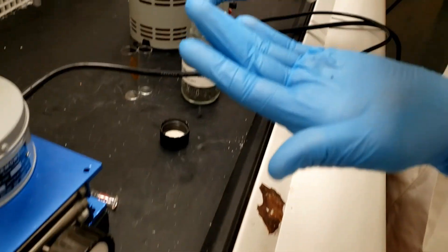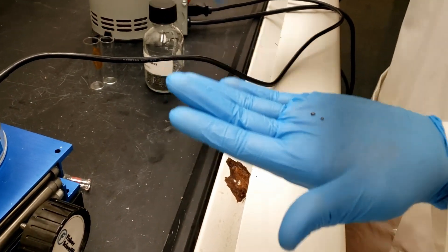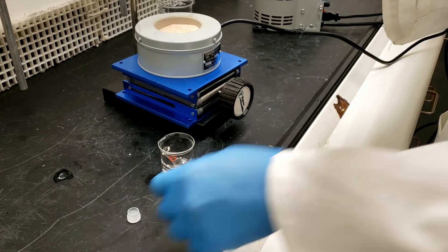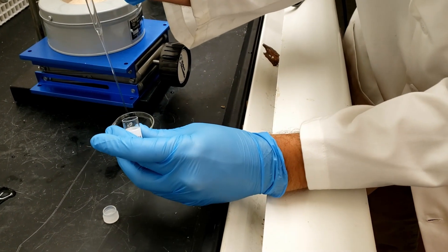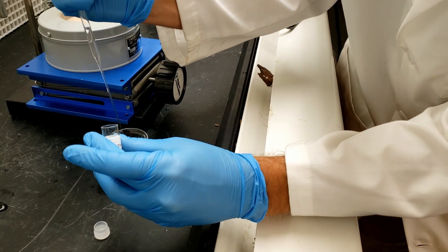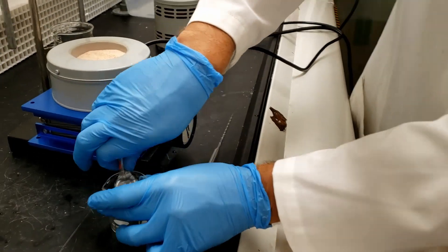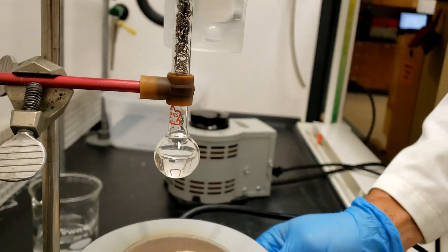Add one to two boiling stones to ensure a smooth and even boil. Now we will transfer our unknown to the boiling flask. Transfer with a Pasteur pipette is highly recommended. Now we attach our boiling flask to the bottom of the fractionating column and make sure it is attached securely.